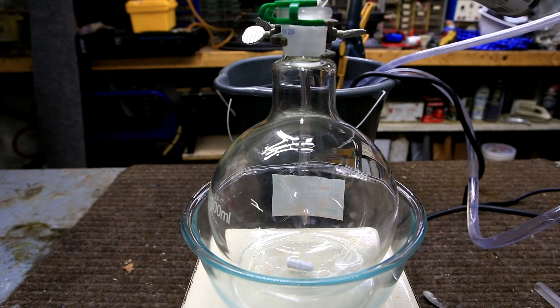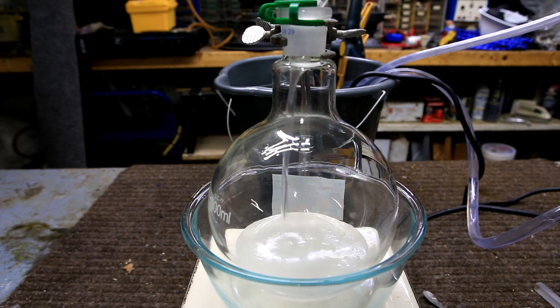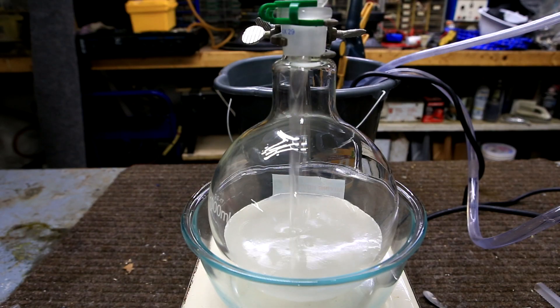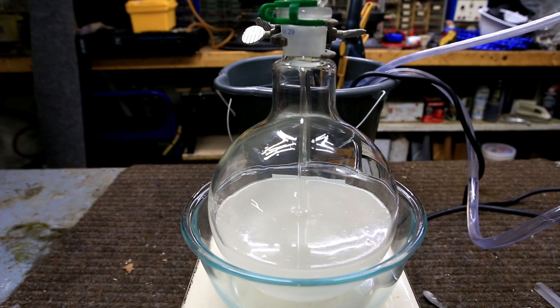Next, the 500 ml of gel was poured into a 1 L round bottom flask. I used a stir bar, but if you don't have a stir bar you can easily use boiling stones or sand as a replacement.